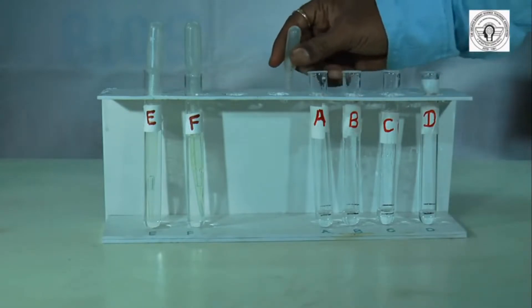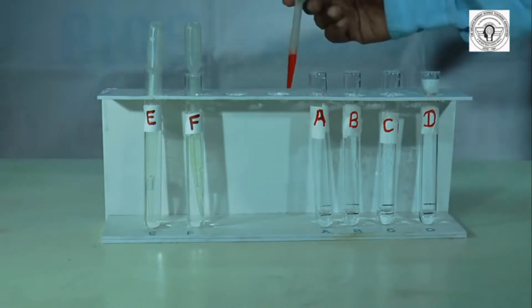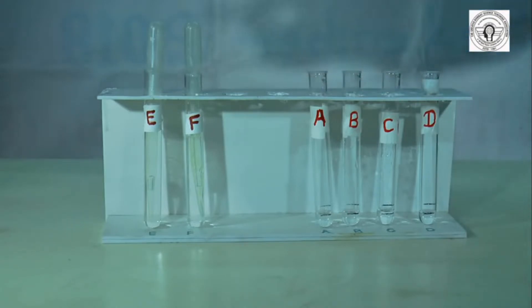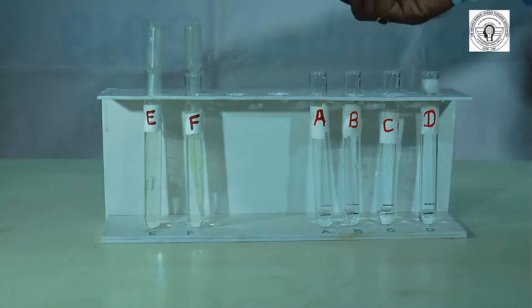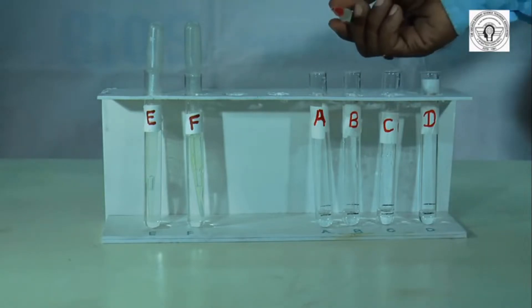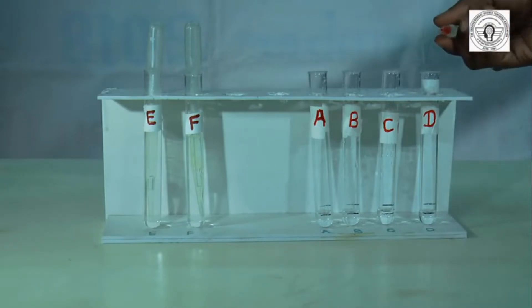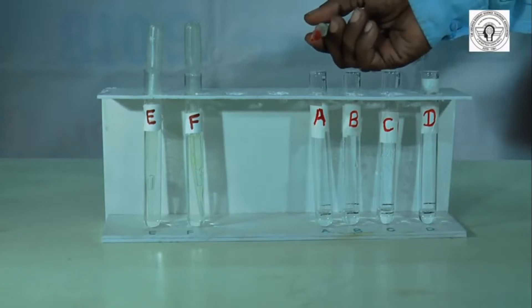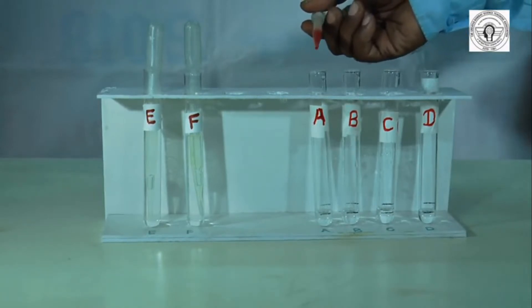Now take the universal indicator with the help of the dropper and add 2 drops each into each test tube — namely A, B, C, and D. You have to observe the color and write it in your observation table.